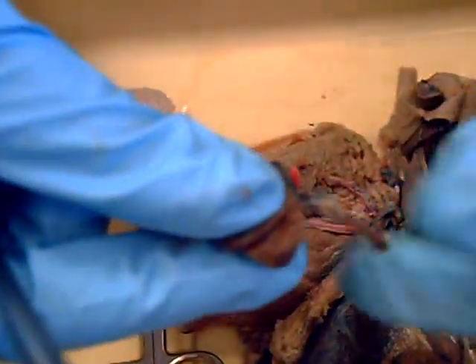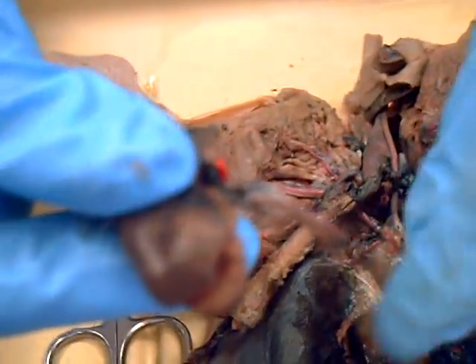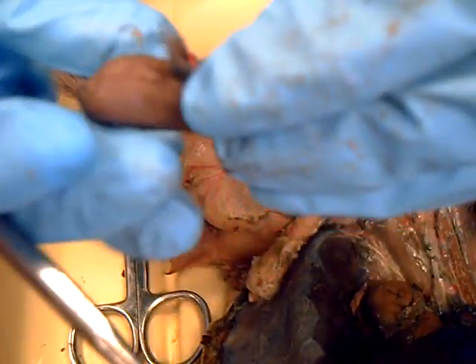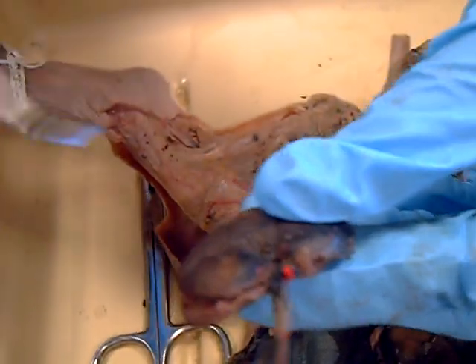Here's Melissa with kidney. When you're looking at the outside of the kidney, here's the ureter coming off of it, and that's going to head down to the bladder. Then its blood supply here is the renal artery. There should be a renal vein somewhere in there too, down here — the blood supply leaving.